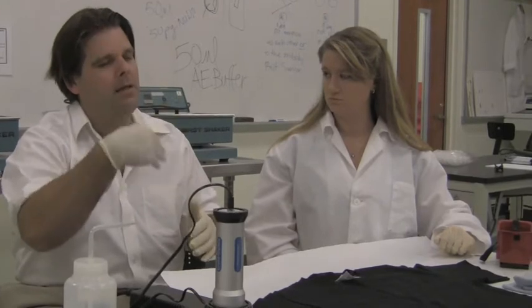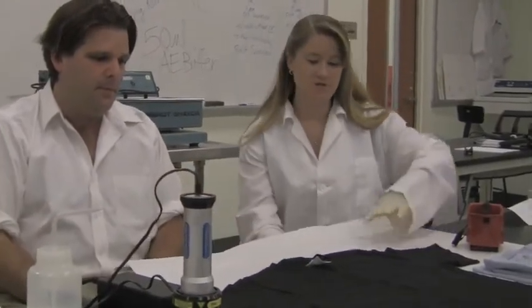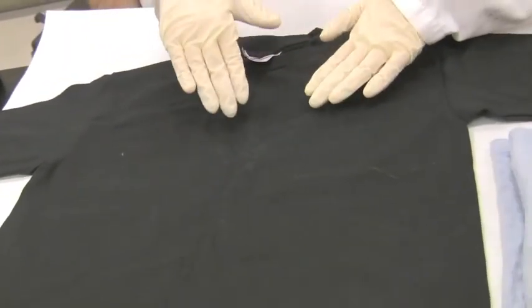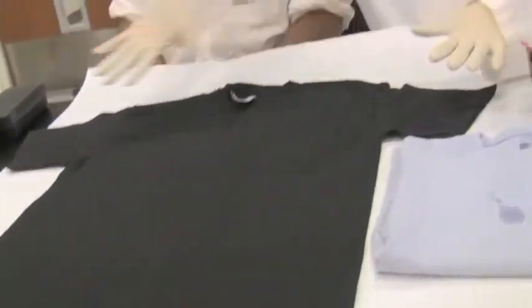Potentially, yes. You can look for stains on sofas, blankets, any cloth material or carpets that will fluoresce. This test can be performed anywhere. So we have this shirt. You want to visually examine first for any type of stains at all — there might be food stains, there might be biological stains. In this general area, I observe a whitish stain on this black shirt, so I'm going to focus on that area to see if there's a stain, though I can also examine the whole garment.